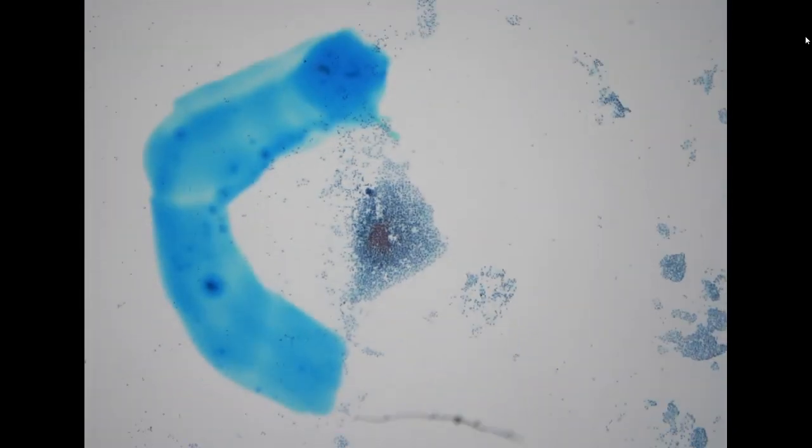So let's move to ascites. The patient has a prior history of pancreatic adenocarcinoma. We received two specimens from the patient. One is only 3 milliliters, which yielded negative, and this is 35 milliliters plus cell block. In this specimen, we can see very scant adenocarcinoma cells.